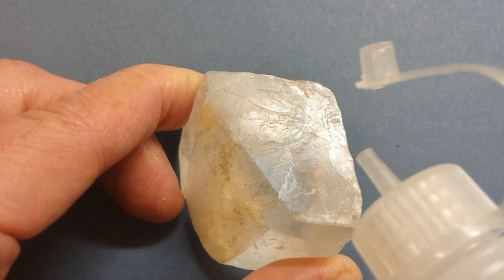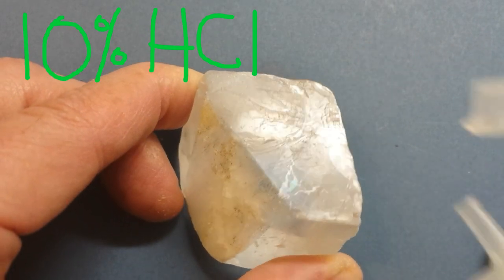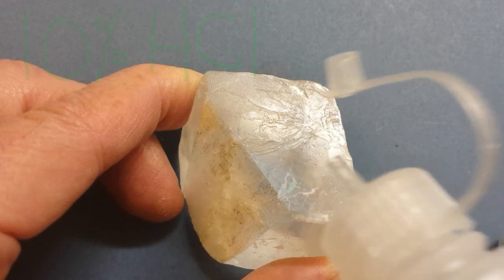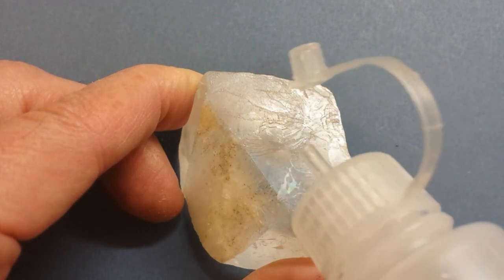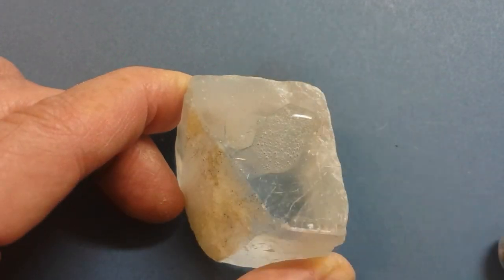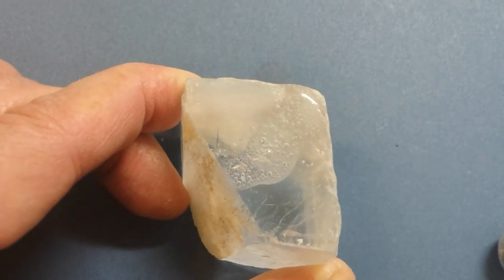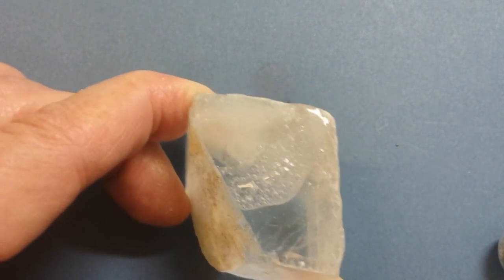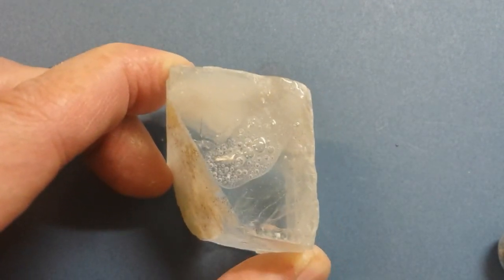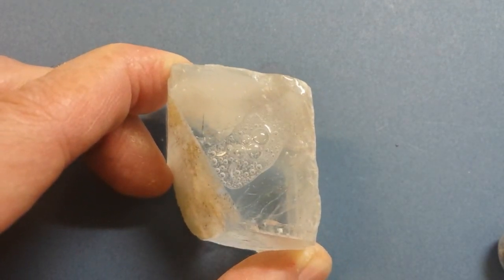Here we put a few drops of cold, dilute hydrochloric acid on a large crystal of calcite. Note that almost immediately, bubbles begin to be generated at the surface of the crystal. This is called a strong or vigorous reaction.